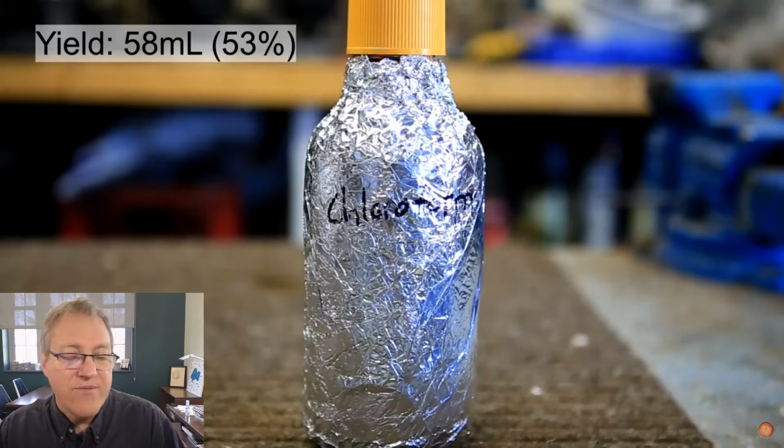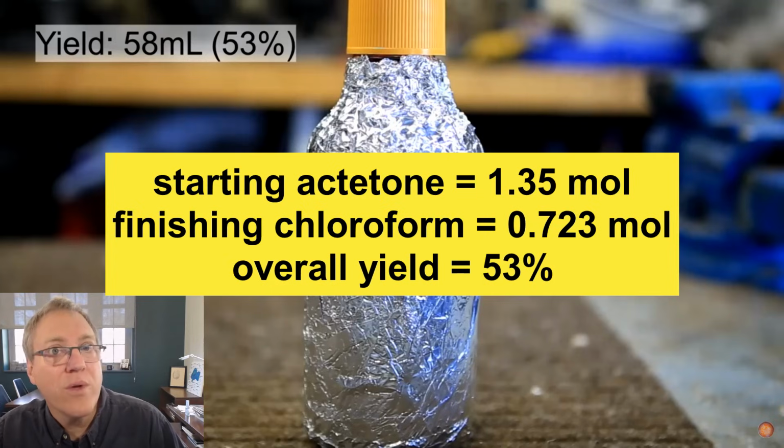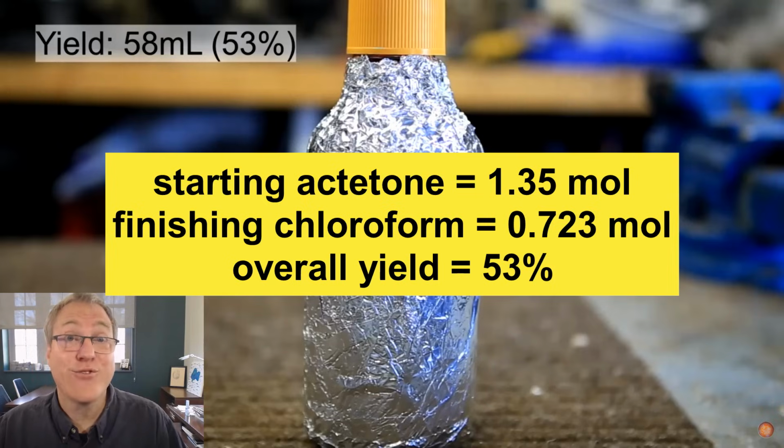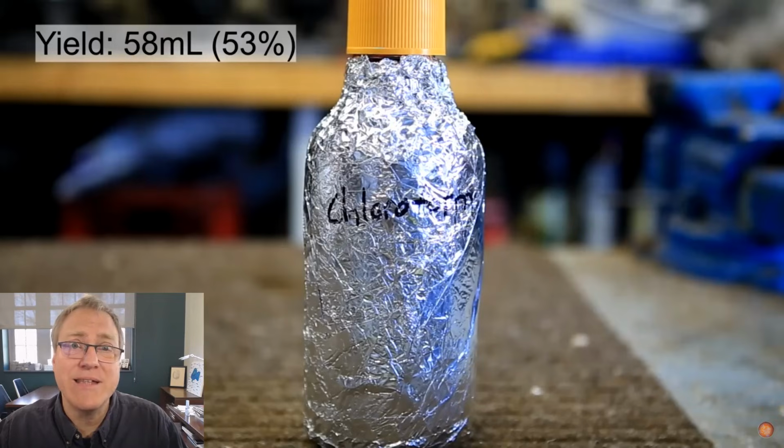Let me look at my notes. 58 milliliters of chloroform is about 0.723 moles. So comparing that to our starting amount, which was 1.35 moles of acetone, that is a 53% yield. And I think that's great. He took a bottle of bleach and 100 mils of acetone and got a 53% yield of chloroform. I think that's pretty impressive. And now it's ready for storage, and he's minimizing decomposition because you certainly don't want to make phosgene as you store your chemicals. So that's the end.